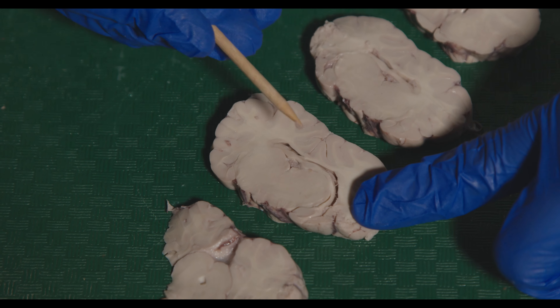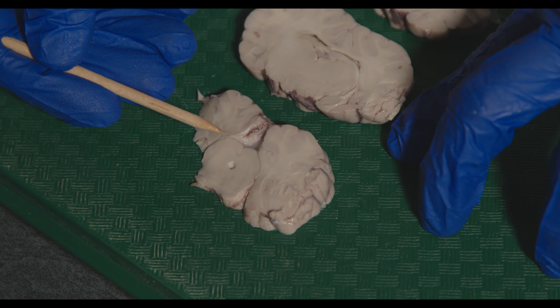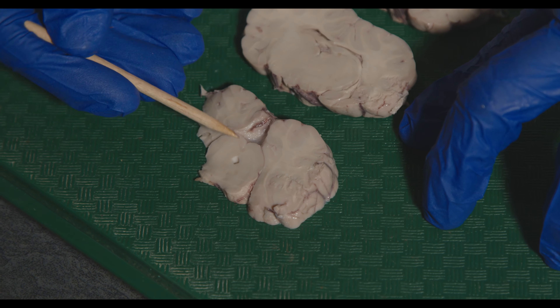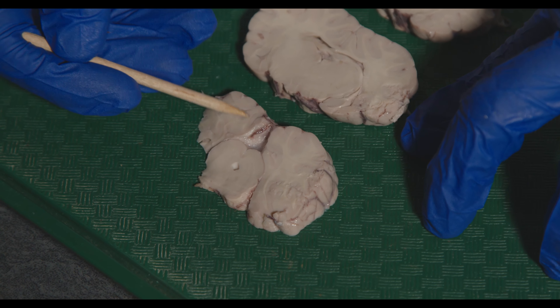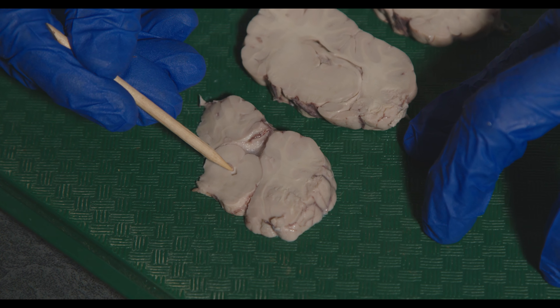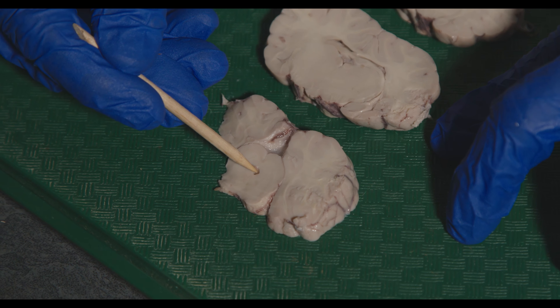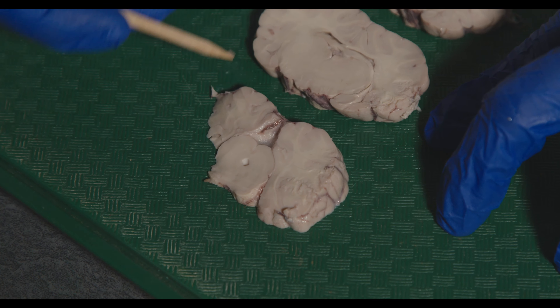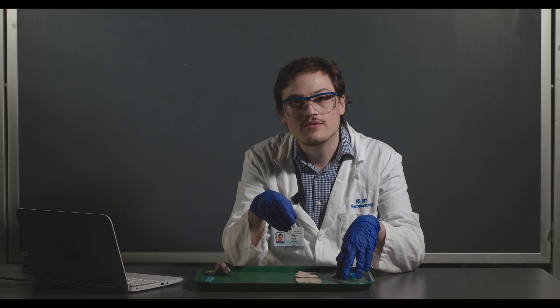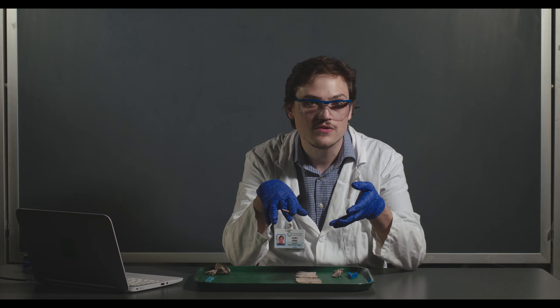Going a little bit more caudal, now we're hitting the midbrain. We can see the superior colliculi — these bumps here. And this structure here is the cerebral aqueduct, connecting the third ventricle to what will become the fourth ventricle as we continue back to the cerebellum. That concludes the sheep brain dissection. All the structures I pointed out — on the coronal sections, the ventral and dorsal surfaces, and the mid-sagittal cut — are found in your lab manual.